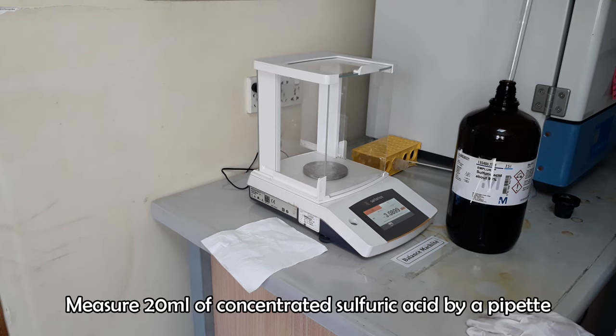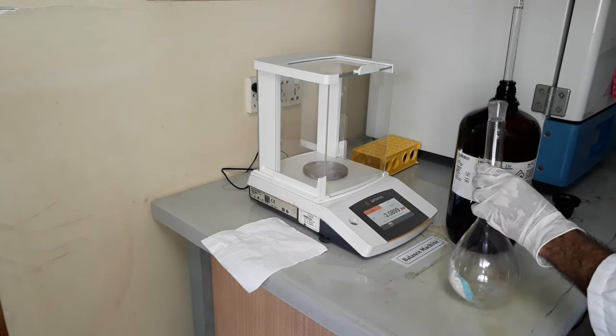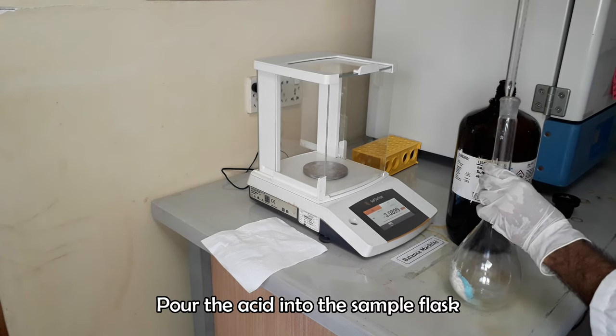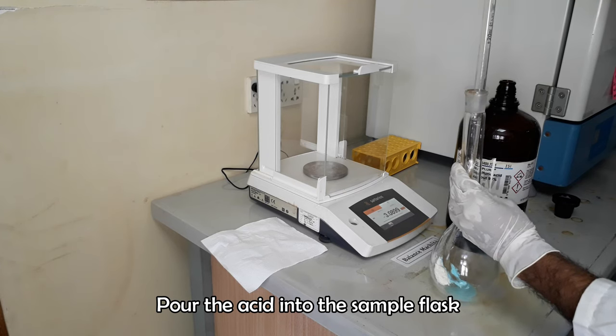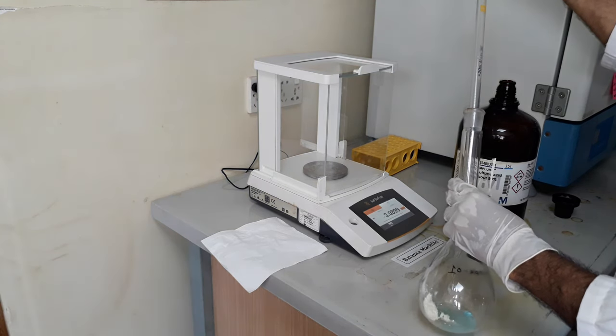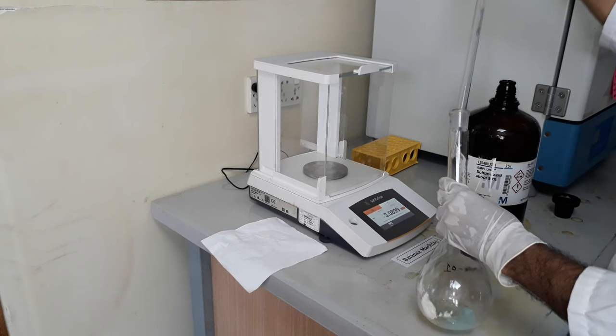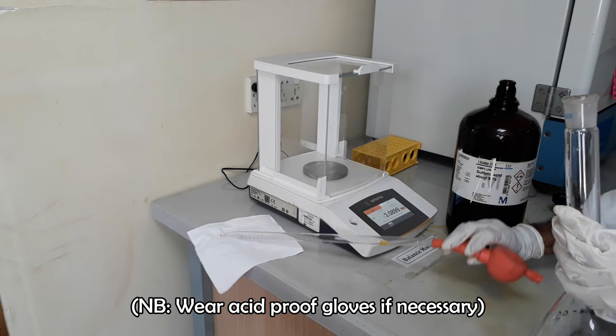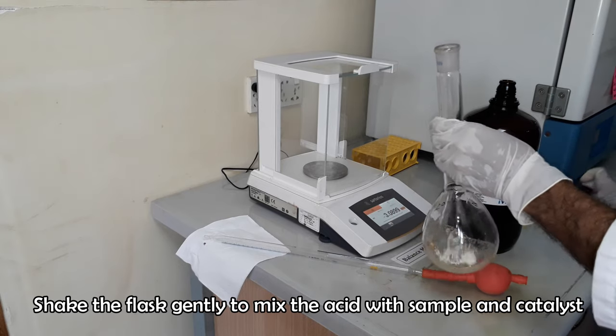Now we have to add 20 milliliters of concentrated sulfuric acid. Shake slowly to mix the sample with the added sulfuric acid and catalyst. Now sample is ready to digest.